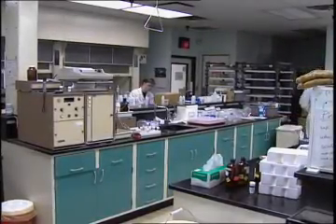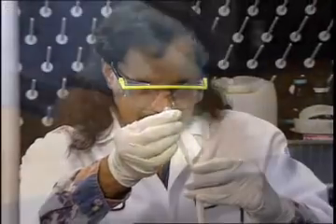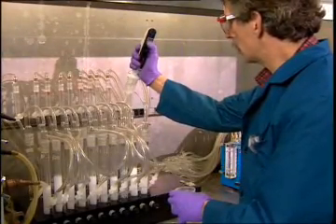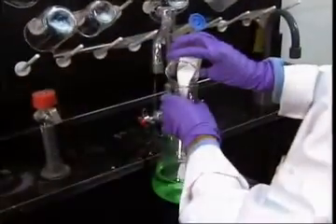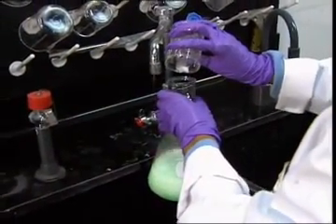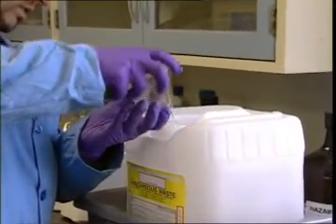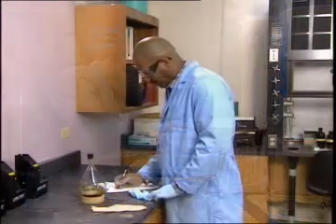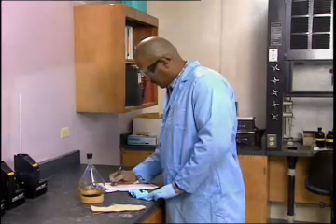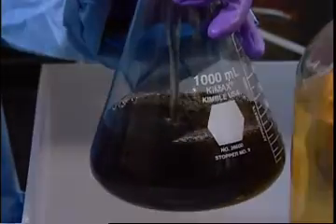As scientists, researchers, and technologists in a laboratory or research facility, you assume a high level of responsibility in your work. You take on a problem, gather samples, supplies, reagents, and equipment, and conduct a procedure or analysis. If your work produces a waste, any waste, one of your responsibilities is to take the required steps to manage that waste properly according to state and federal regulations. To do that effectively, you need to know how to identify the wastes generated and how to manage, handle, and control each to keep them out of the environment.